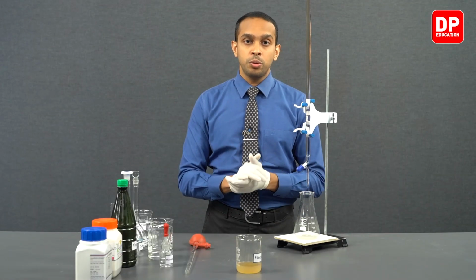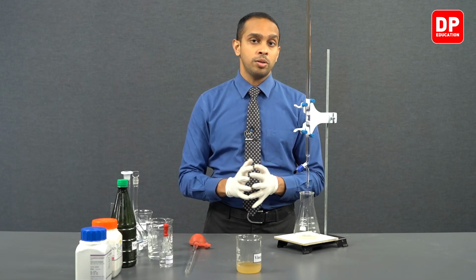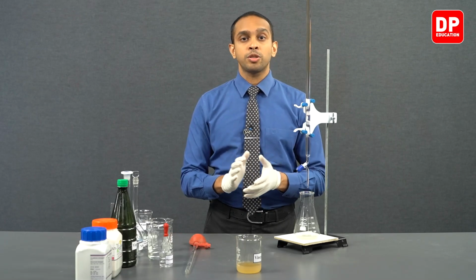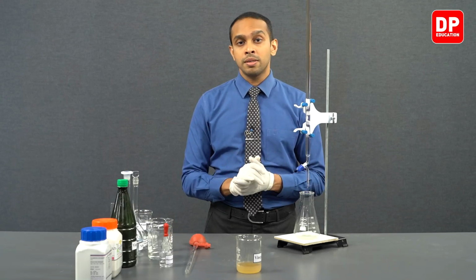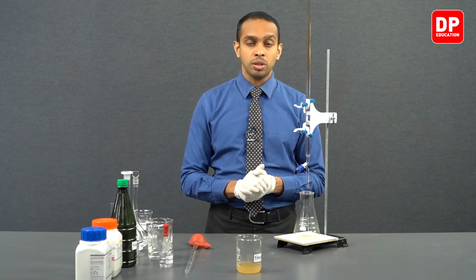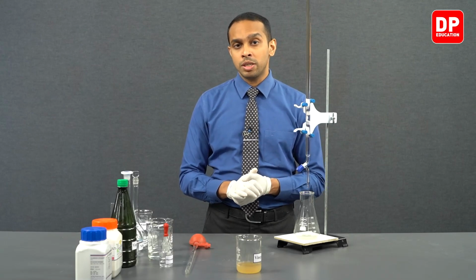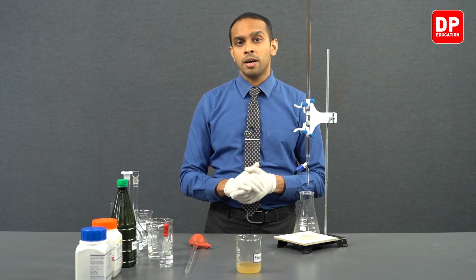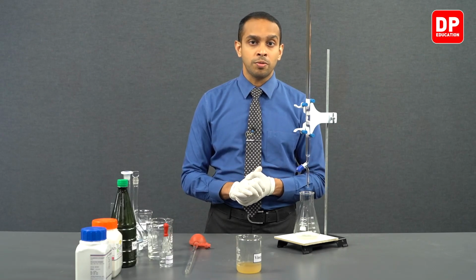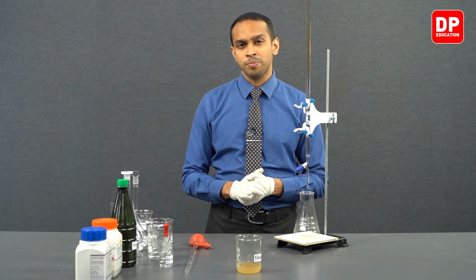In the first 2 titrations, we learned that the amount of sodium hydroxide used in order to obtain a very clear color change in the solution was 21.3 and 21.4. So roughly around 21.3 cubic centimeters of sodium hydroxide should be added to this titration.